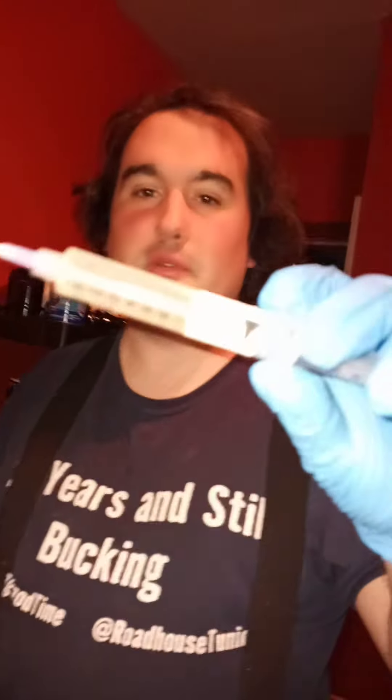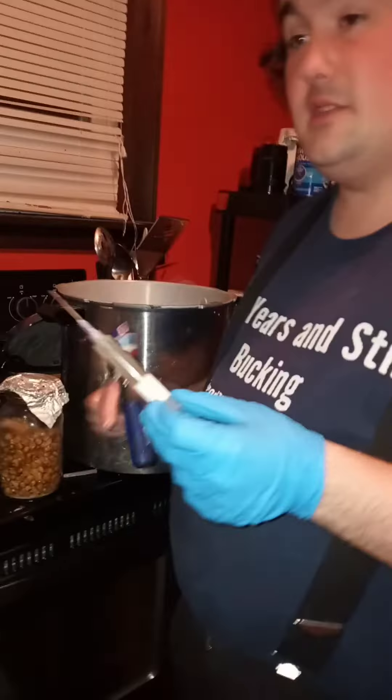Here again, teaching basic mushroom facts. This is a long video. This is shiitake liquid culture — I have a jar of it myself that I've extracted, and I'll teach that another time. I'm going to teach you the basics of needlework and what to do with new jars.